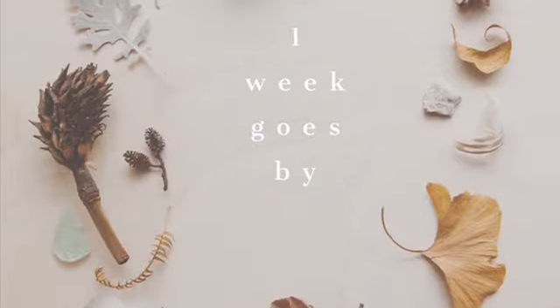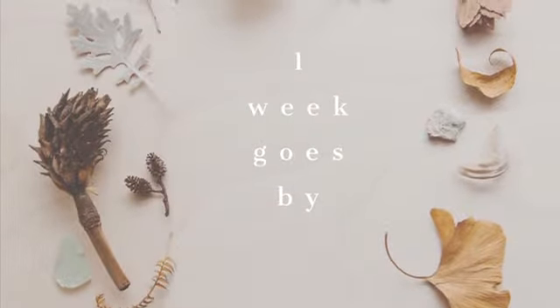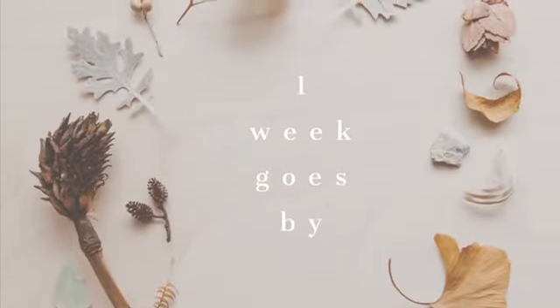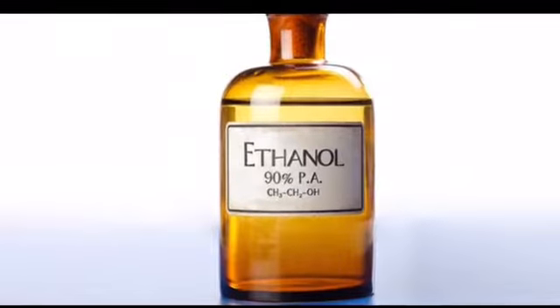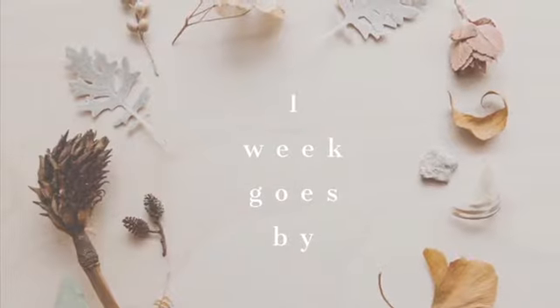After 1 week, fly nap was administered to the parental flies so that they could be removed efficiently from the vial and only the larvae would remain. The parental flies were placed into an ethanol bath where they were then euthanized. The larvae were left to hatch for 1 more week.